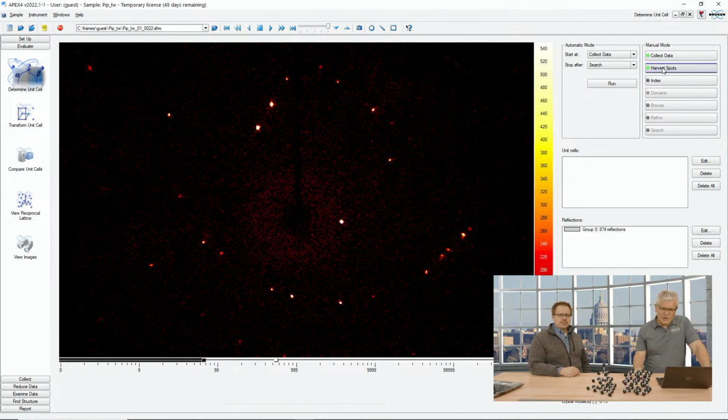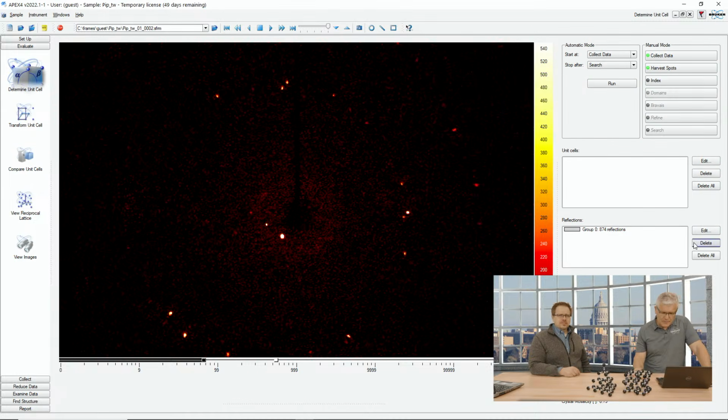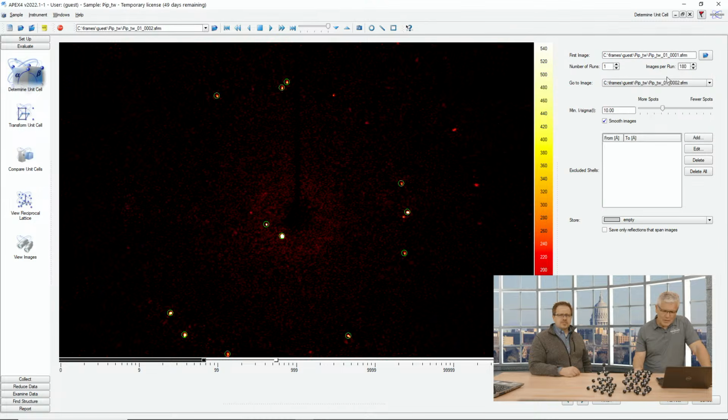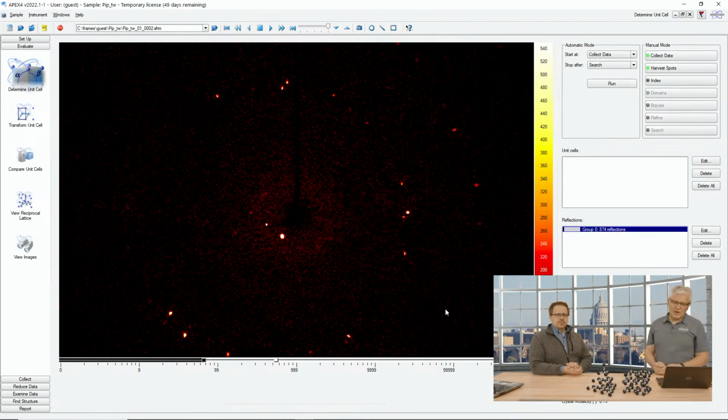What we will do is, I will delete the reflections that I already had collected or harvested. We'll do this again. I will now harvest reflections, which means I will read all the reflections or the spots from the frames. We'll put them together, and then we'll put them in reciprocal space, where all these reflections sort of live.